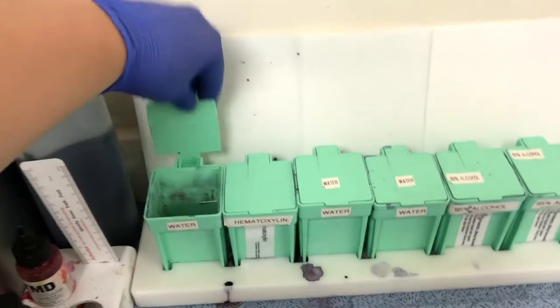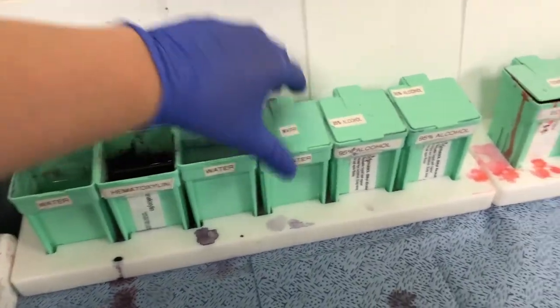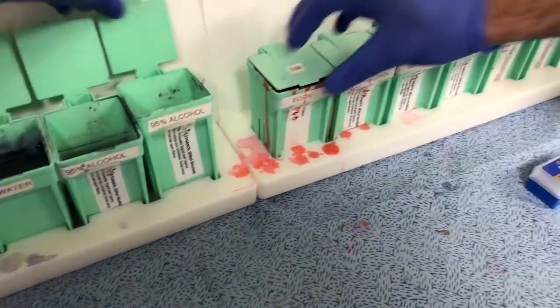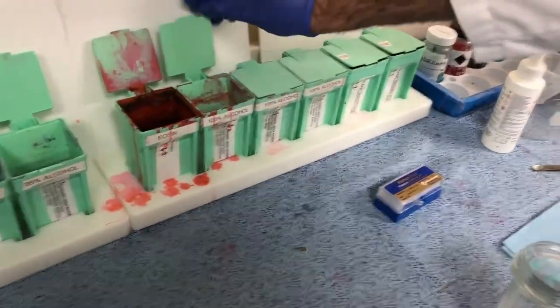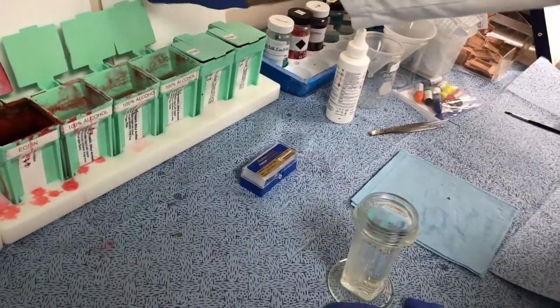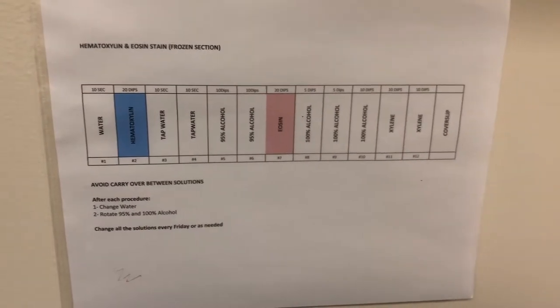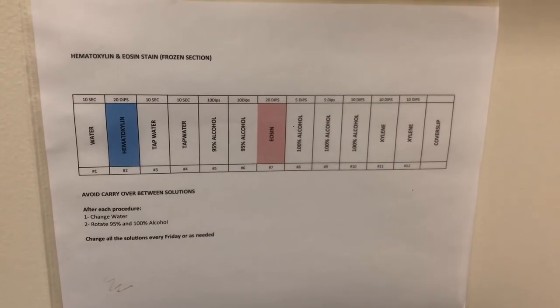Take your slides over to the bench where we will next do an H&E stain. There are specific instructions written on the wall for how to do this.